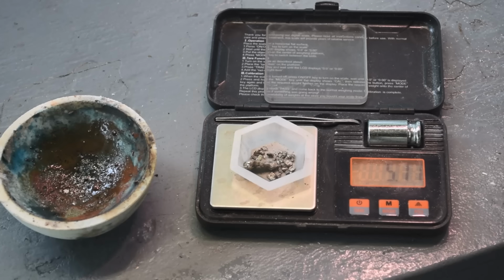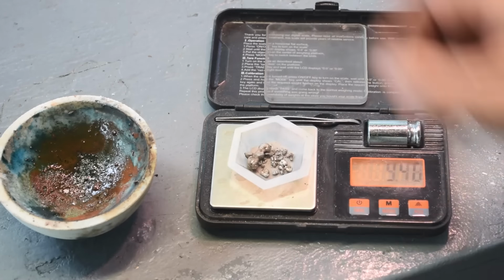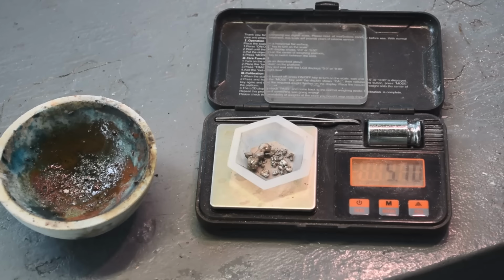You know, that yellow liquid, I poured it into my stock pot. That, I'm sure, had a little bit of palladium. And I doubt it had this much, though. I mean, that was really fine stuff that went through the filter. So, I don't know, Joven. Yeah, kind of screwed the pooch on this. I have to admit it.